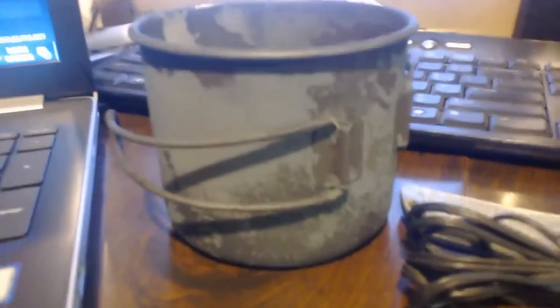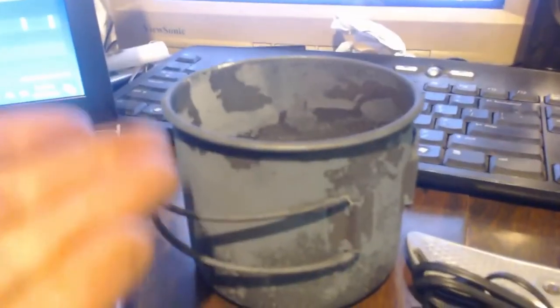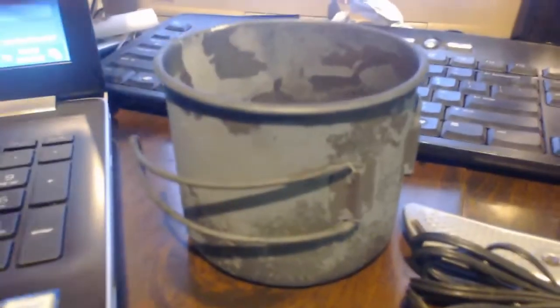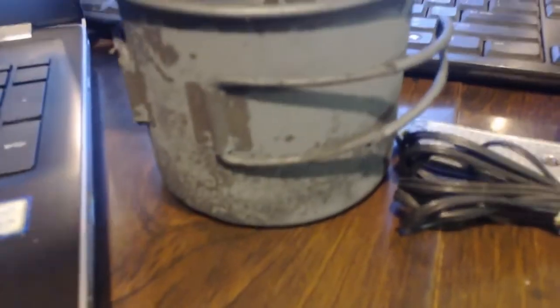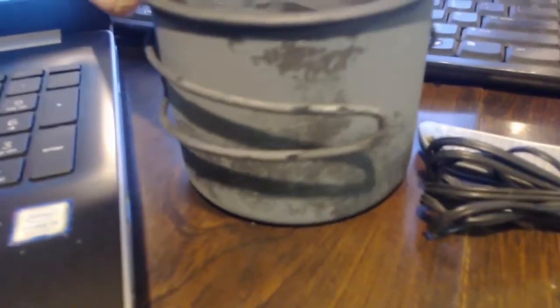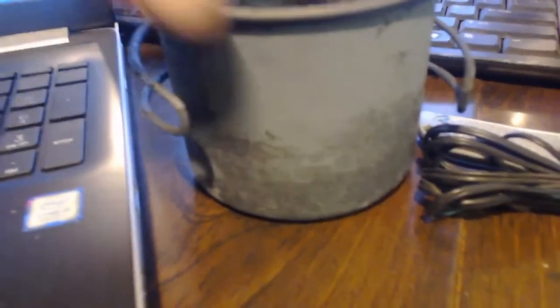I just wanted to show you that cup from the last video where I did a calcination. It had calcium carbonate and I heated it up till it decomposed into carbon dioxide that left, and in the pot would be left calcium oxide. Now look at this. This was brand new, nice and shiny. I never used it. Look how it peeled off. I don't know, maybe now it's good. Once it peels that crap off, it won't peel again.